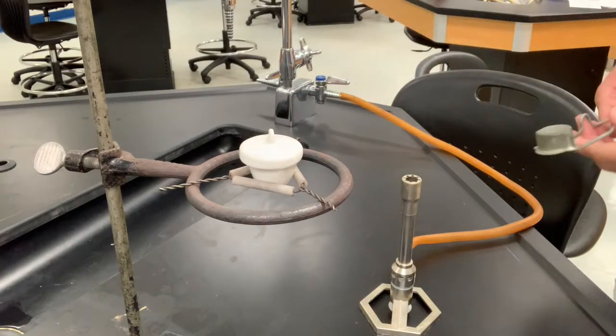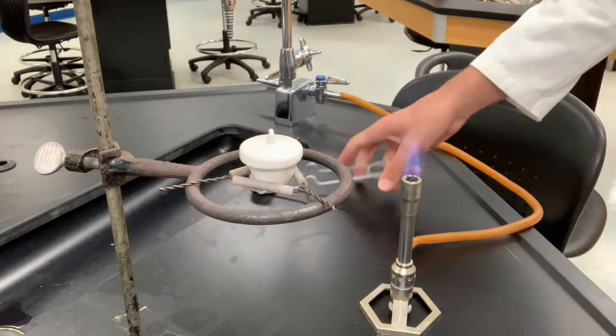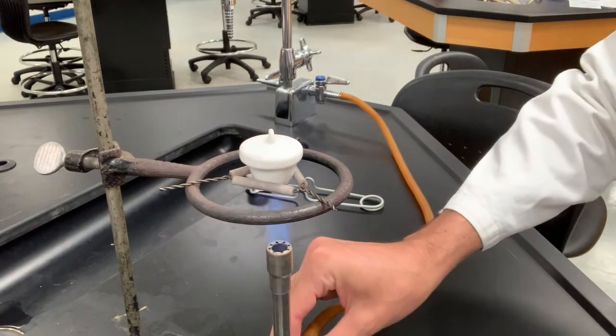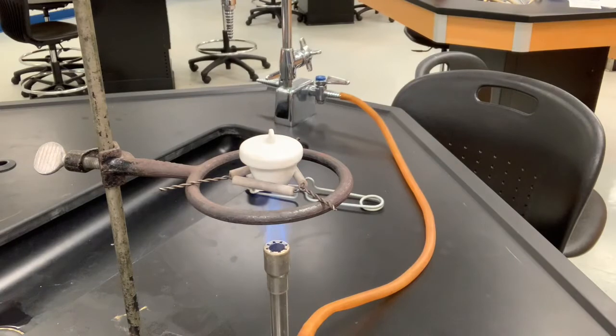So let's get this fired up here. Again, I'm not worried about the procedure and being all careful and stuff. I'm just blasting on this and letting it go.